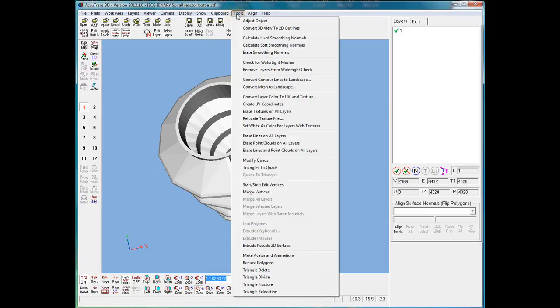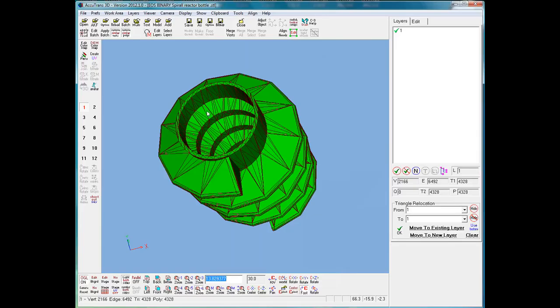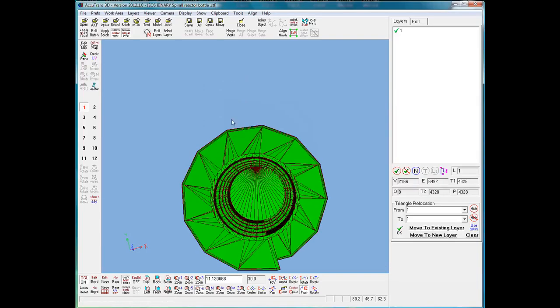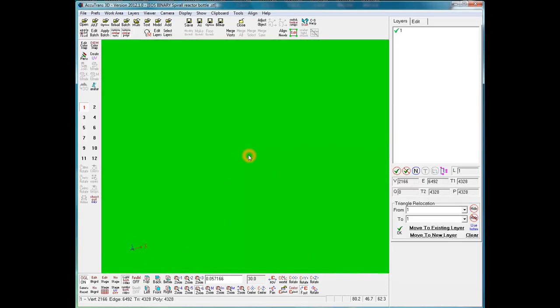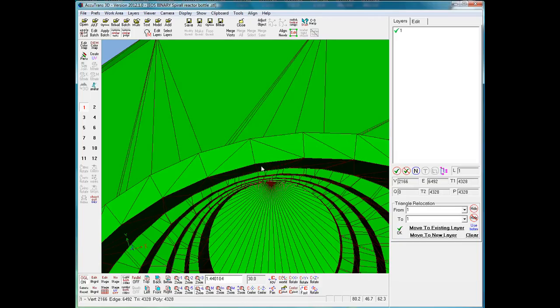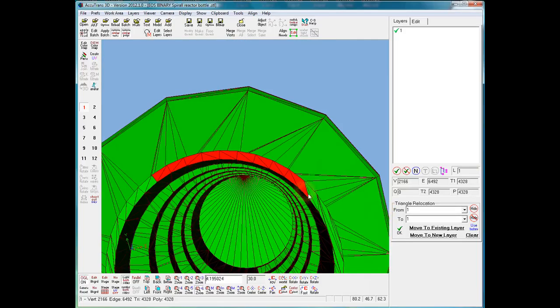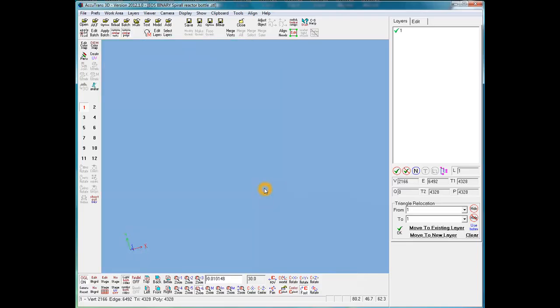So we'll go to the Tools, Triangle Relocation menu command, and then we will click with the camera, with the middle mouse button, and set the camera pivot point at that point, and now we'll start selecting triangles. Now, to keep moving around, all we have to do is wherever the cursor is, just click the middle mouse button, and that point moves to the center of the screen, and then we can just carry on clicking. Sometimes it's okay to zoom out to see where you're at and come in.